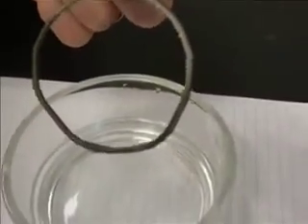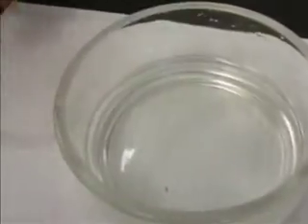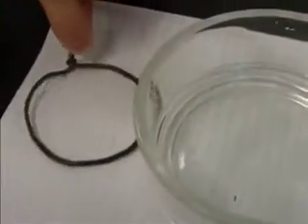That's pretty cool. Mr. Sams, why don't you put that on that little piece of paper maybe, and I bet it'll flake off. Just kind of tap it. Some of our silver metal there on the paper.